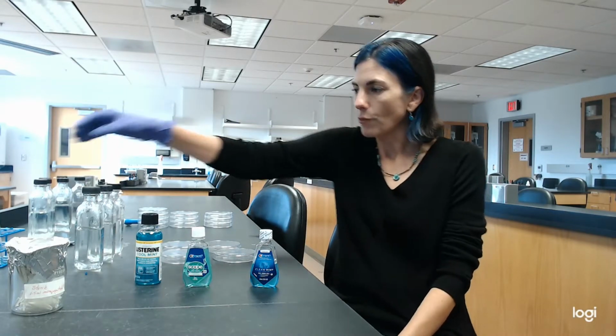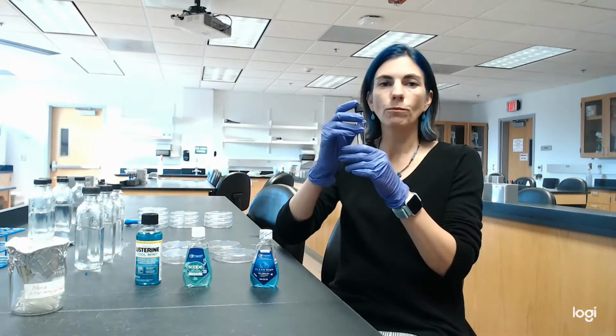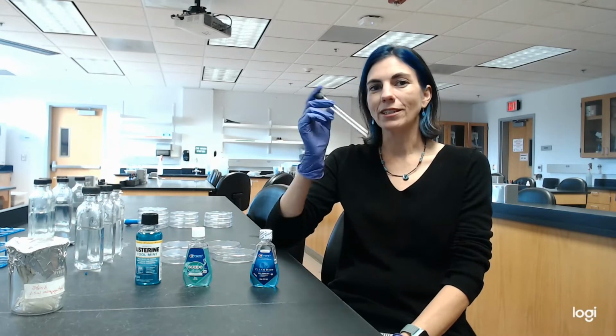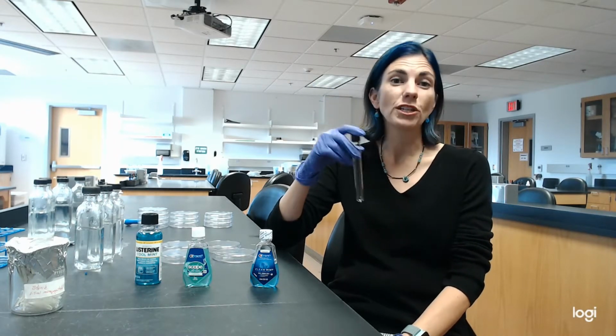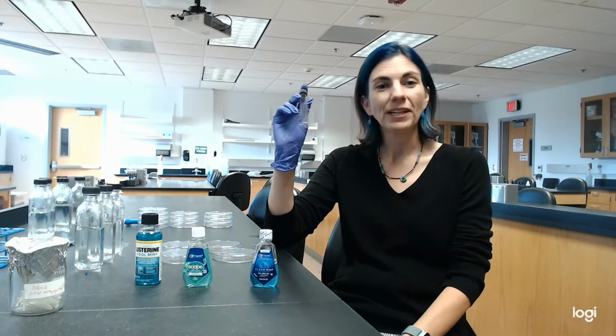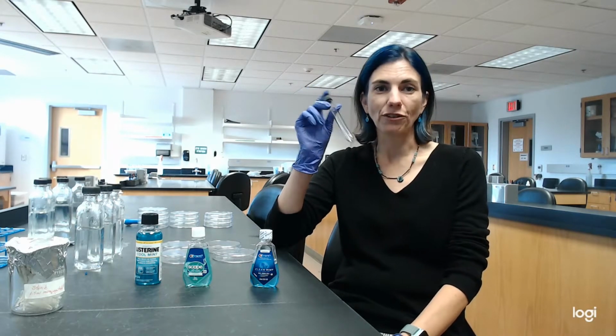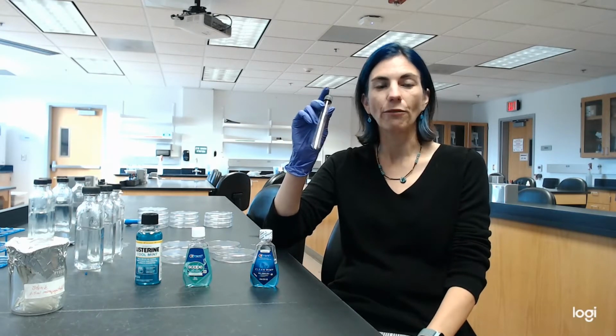So the way that this particular lab is going to work is I'm going to collect some saliva. I'm going to collect at least 2 mils in here. I will not be filming that part so that you can keep your lunch down while I'm bringing mine up. So you'll just have to trust me that yes, I'm going to be spitting in here and there's going to be 2 to 2.5 mils in there.